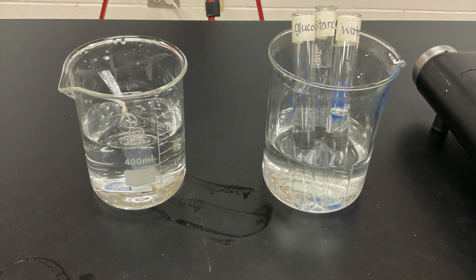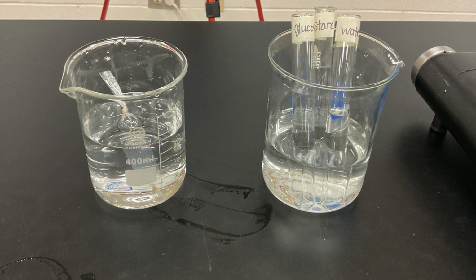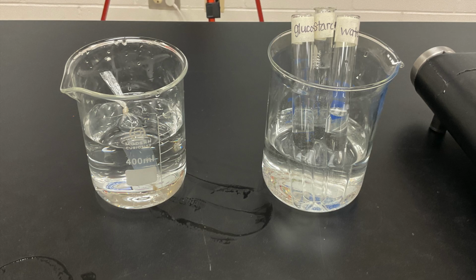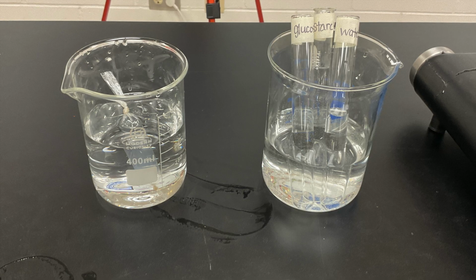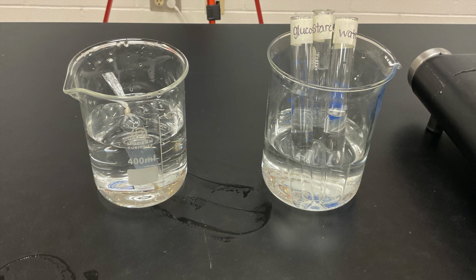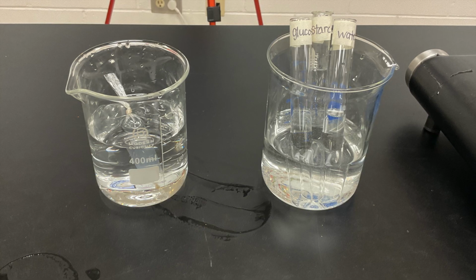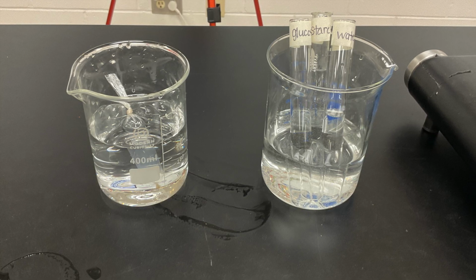Take a moment to observe. Beaker 1 contains water. Later on in the video, you will notice that the color changes to brown. This is because we will be adding iodine to it. In the beaker, you will notice a bag that is the dialysis tubing. The tubing contains a solution mix of starch and glucose.